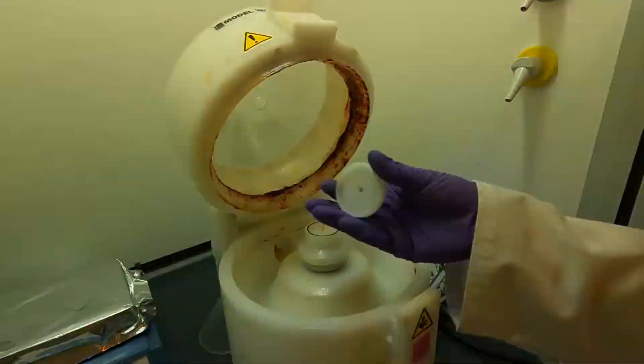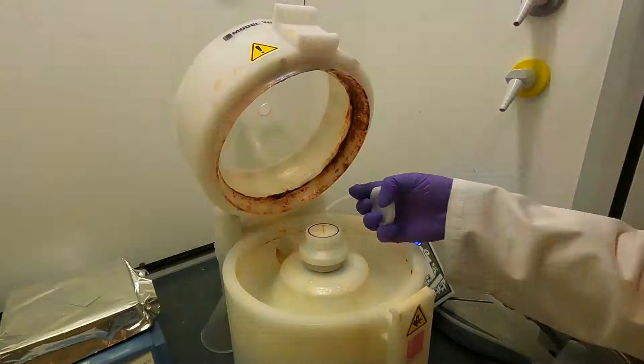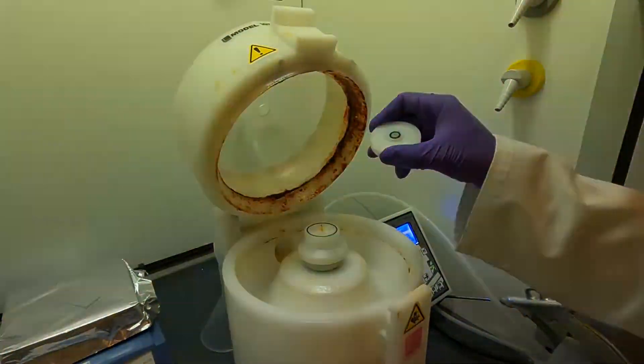Because we're using a glass slide now, we can't go directly onto this rubber seal because it's too big, so we have to use an adapter like this one.